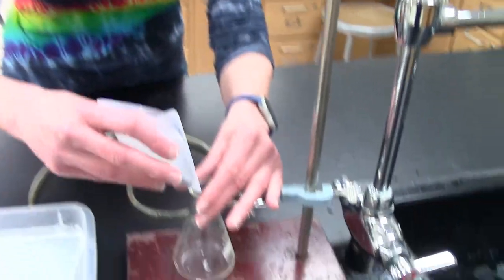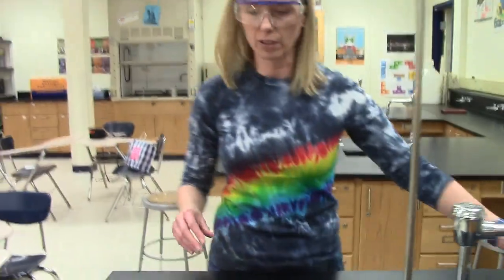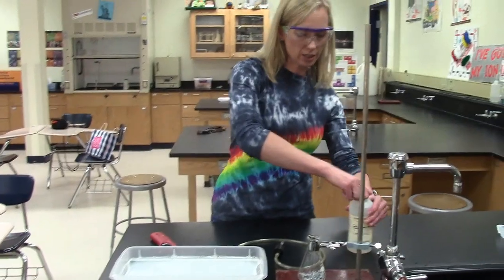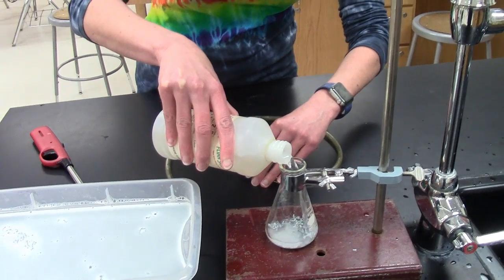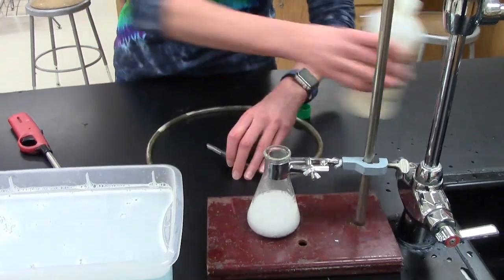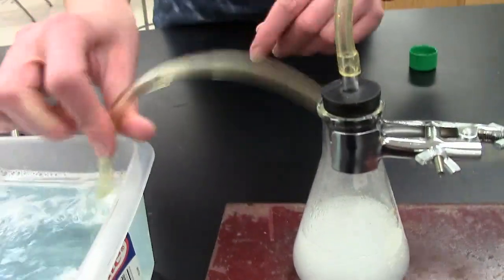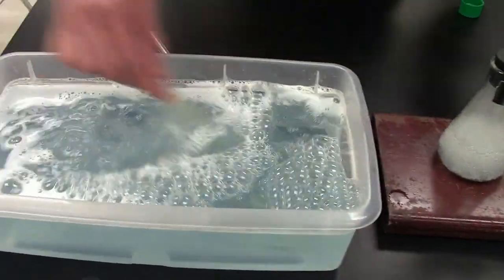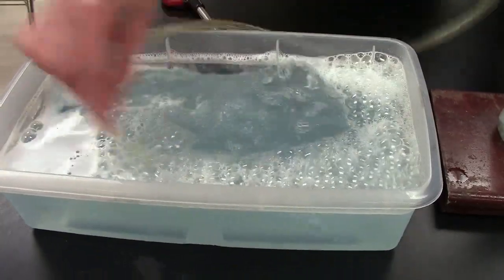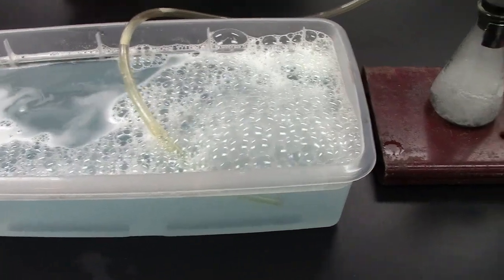So I'm going to take the solid zinc metal, and put it in the Erlenmeyer flask. And now take my bottle of hydrochloric acid and just give enough to get this chemical reaction going. Notice the bubbles immediately. The bubbles are, of course, a sign of gas production, and that is the hydrogen gas that is being produced. We're going to try to thread that into our soapy water and hopefully get some bubbles created that don't just have normal air in there, but actually have hydrogen gas in them.